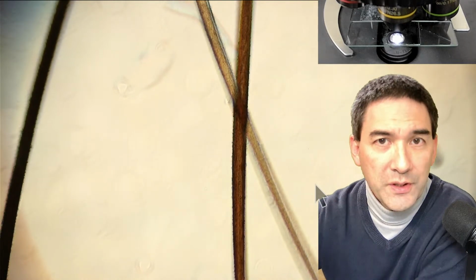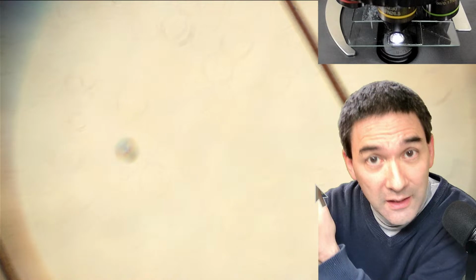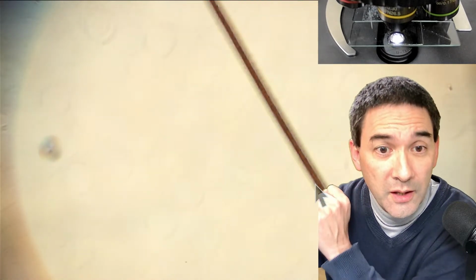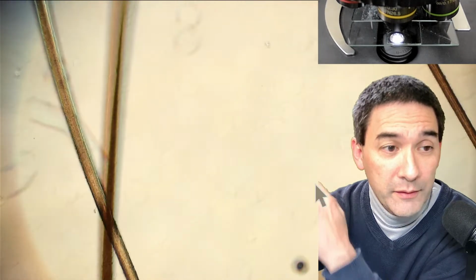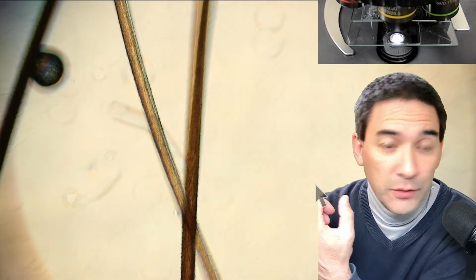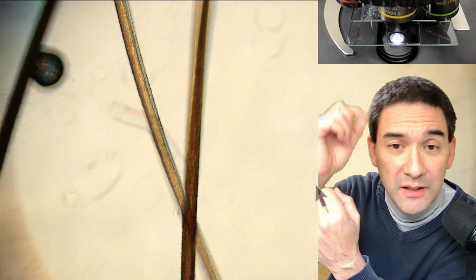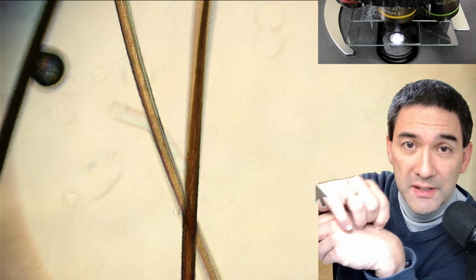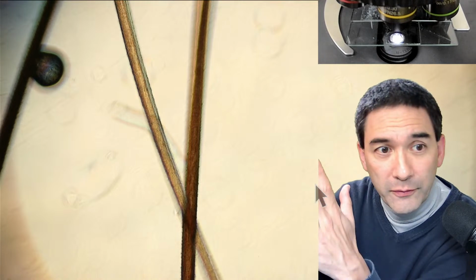Sure, because different people have different hair. For example, in my case, I'm going to show you my hair later on as well. I've got black hair, and also fairly thick hair, so you're going to see that my hair looks different to the hair of the students that I have here. However, let's not forget that even from our own body, hair from different parts of the body looks different. For example, the eyebrows and the hair here and the fine hair on my skin also look different. So there is a huge spectrum of thickness, for example.